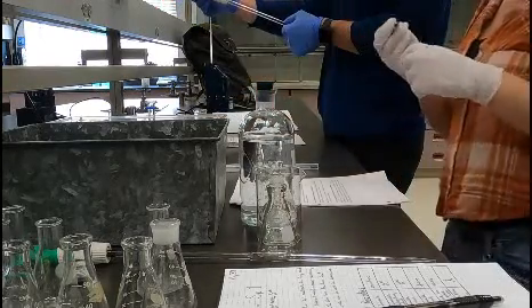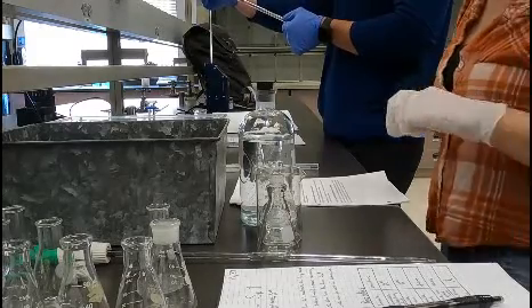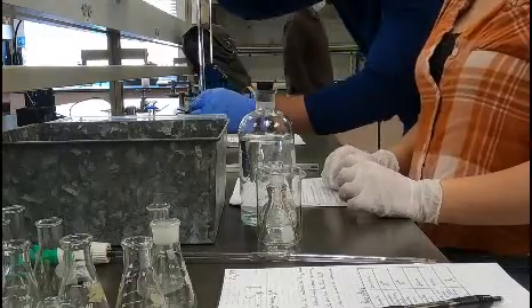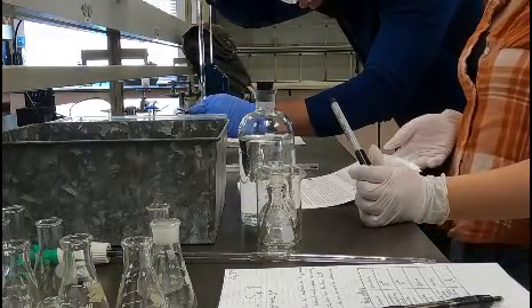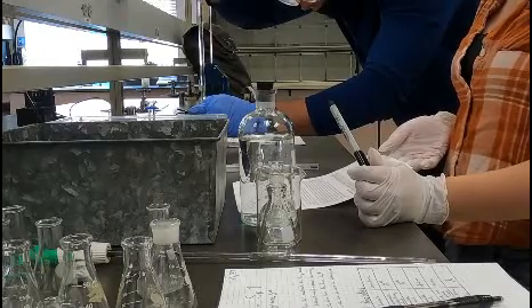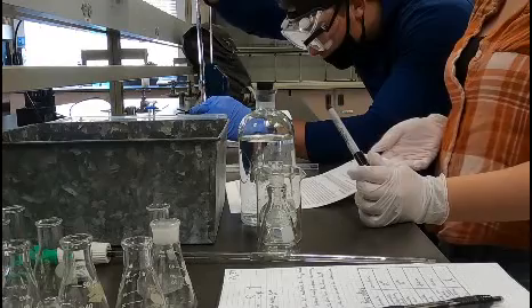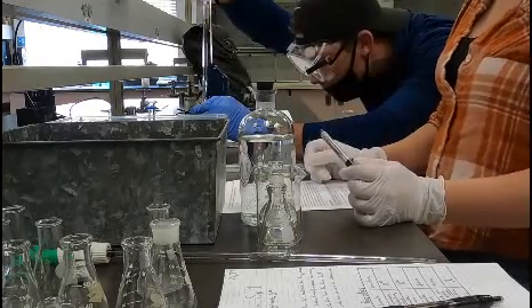So what are you guys going to observe? Well, it's supposed to change to a green-yellow once it finishes, and we have to record at that time — because that's when it gets to a tenth of... So what's being exhausted at that point? So why is the pH indicator changing?